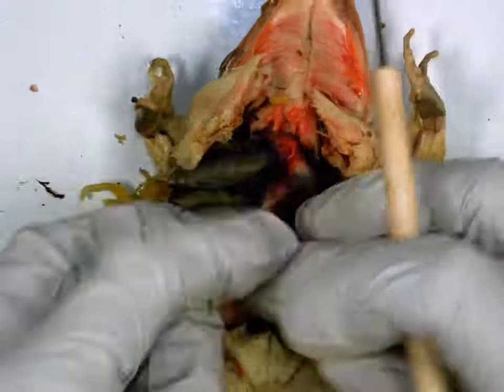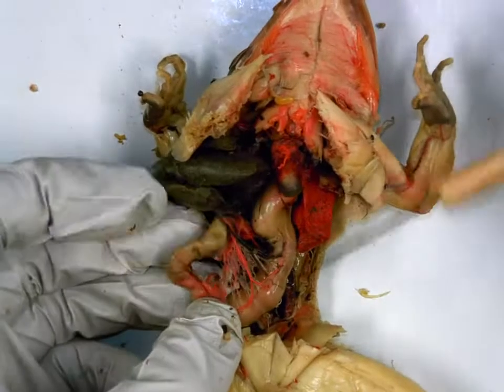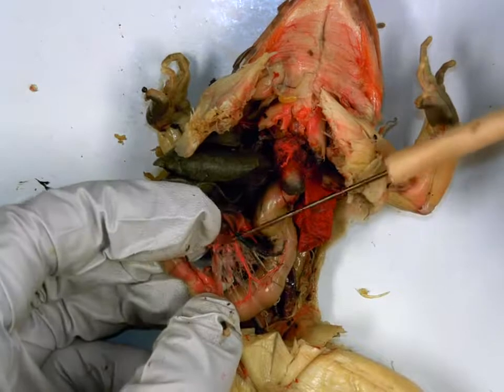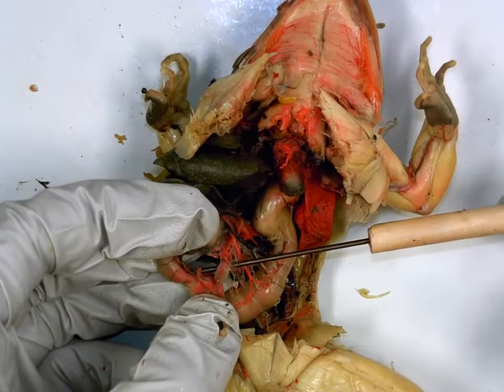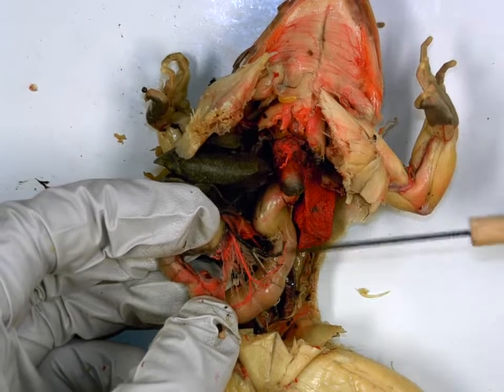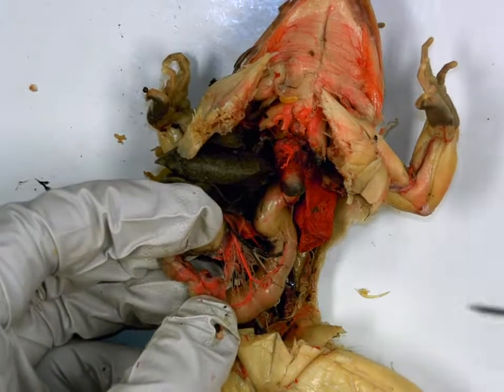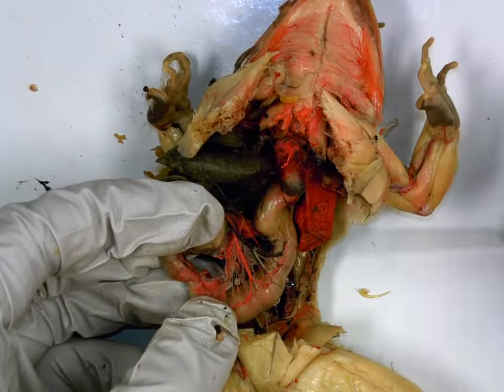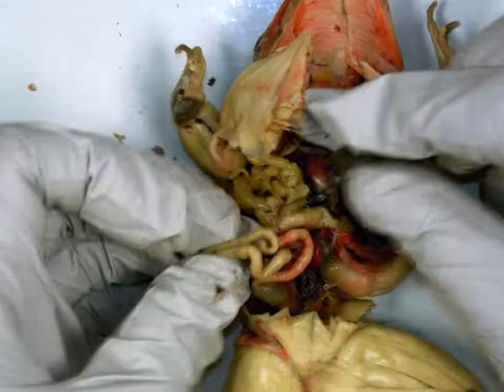Now, the one thing you can cross out that I will not be able to test you on is this thin membrane in between the J shape of the stomach, the pancreas. But it is so thin, it's impossible to pin and test because it's just this thin yellowy material in between the mesenteries. So you can cross that out on your lab because I can't pin it, which means I can't test it. Okay?